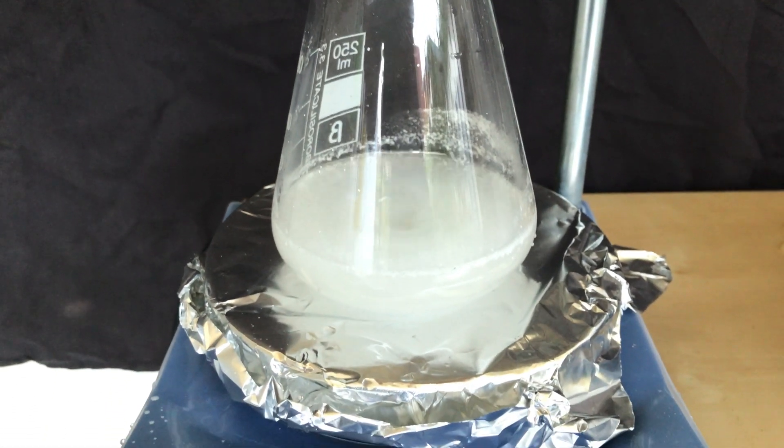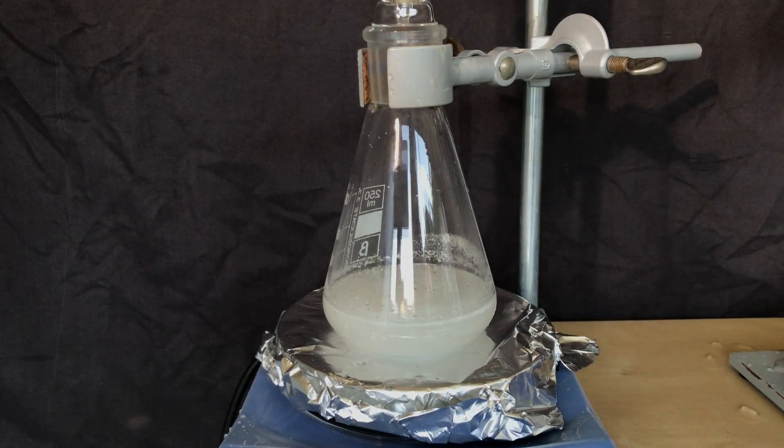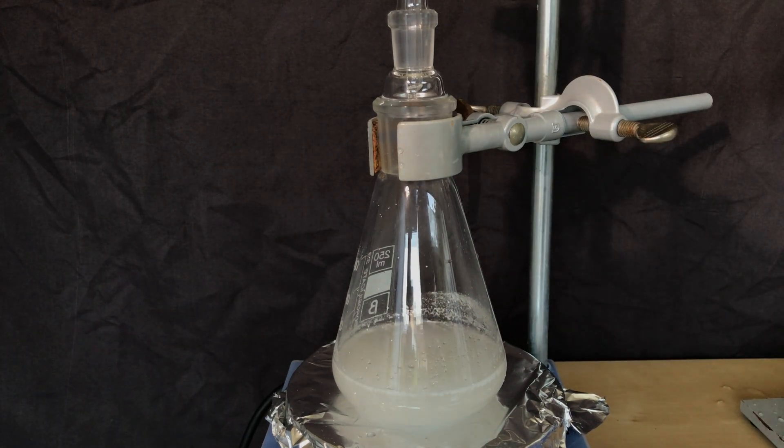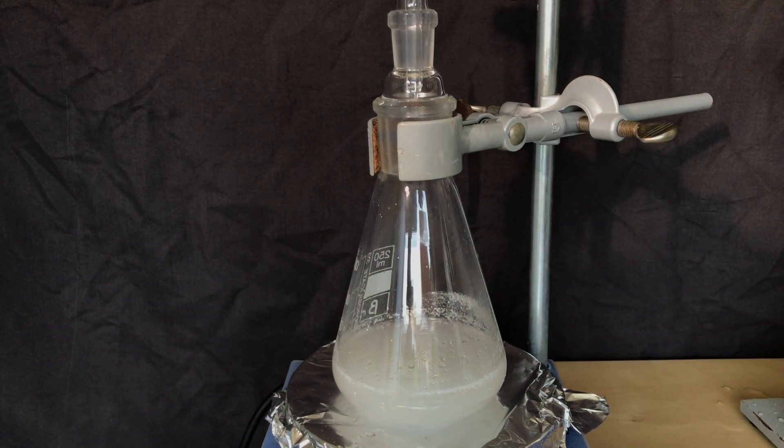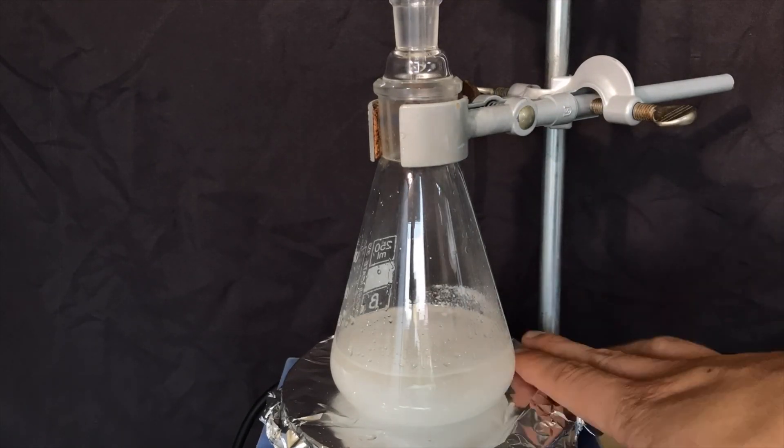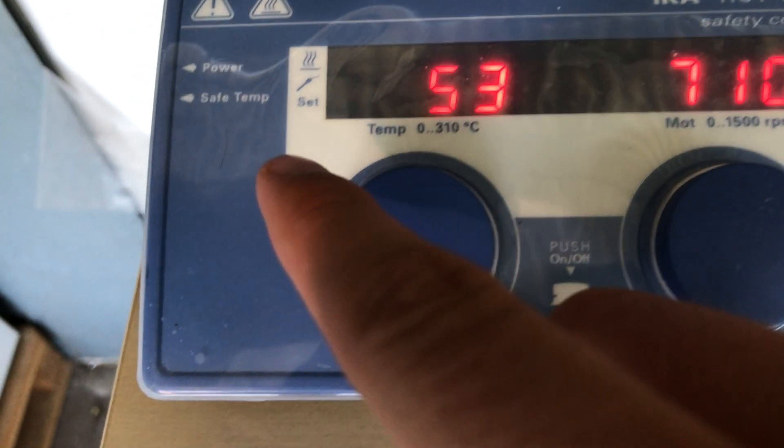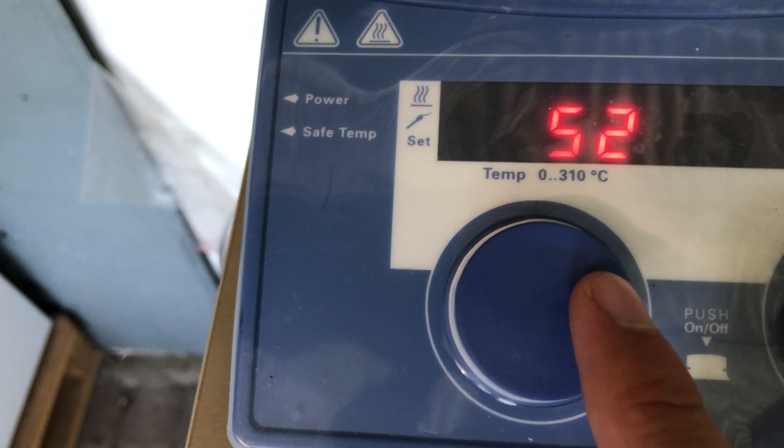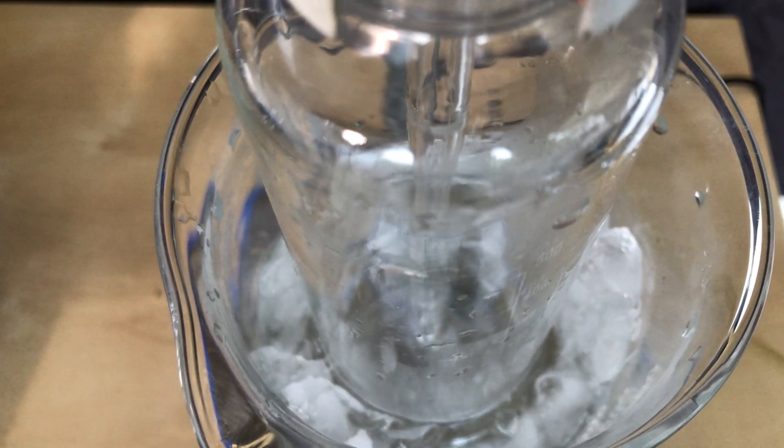I didn't assume that we would be able to see immediate gas generation because dimethylamine is highly soluble in water and therefore it will stay in solution at first. But I also didn't assume that we would have to crank up the hot plate to 120 degrees Celsius before we saw any gas generation. Good mixing is crucial for this preparation, so we kept our spirits up and hoped for the best.